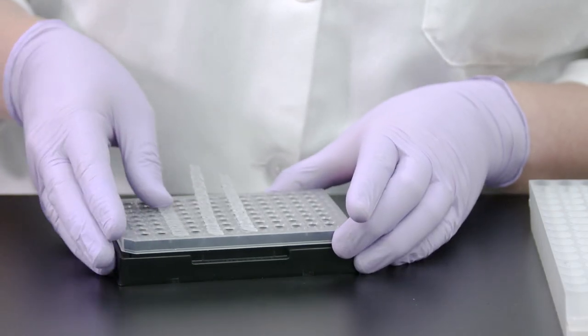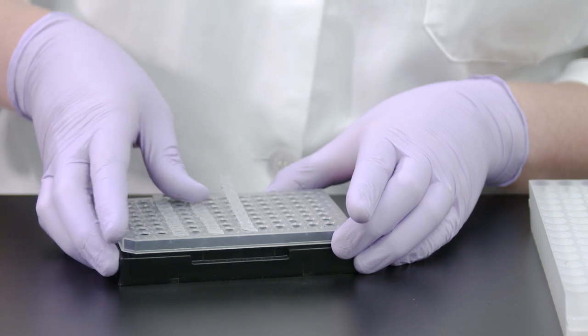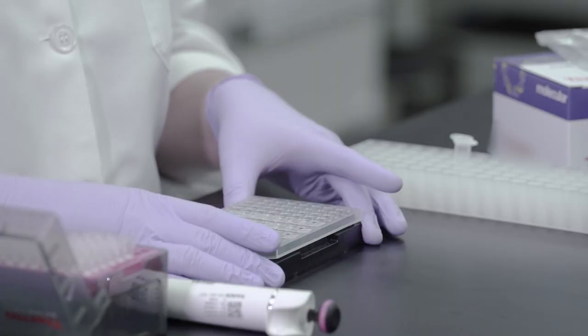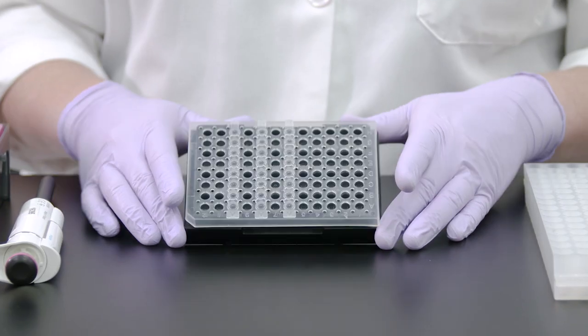Secure each cap strip onto the plate using sufficient force to ensure all wells are secured. With these methods, you can quickly and reliably seal your choice of PCR plates.